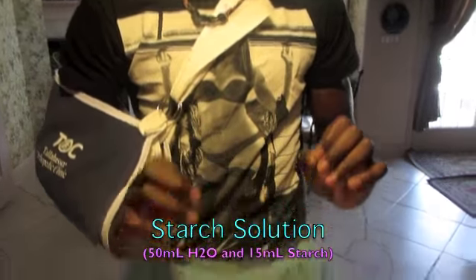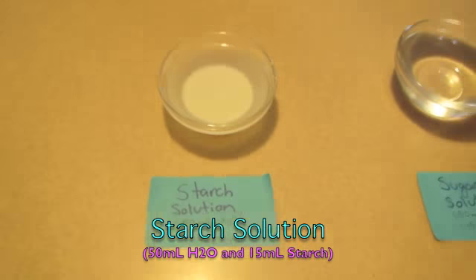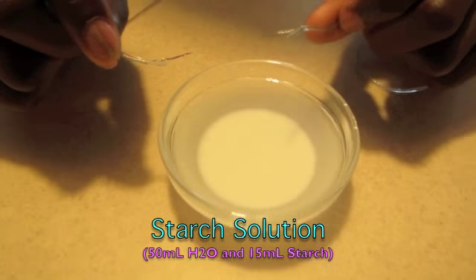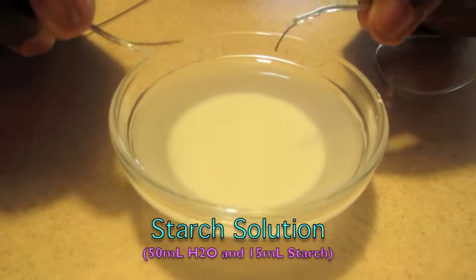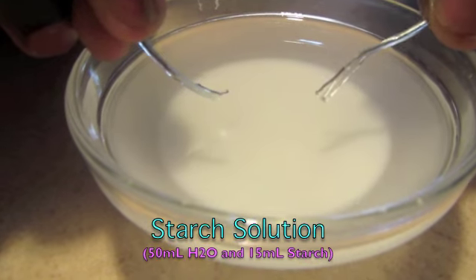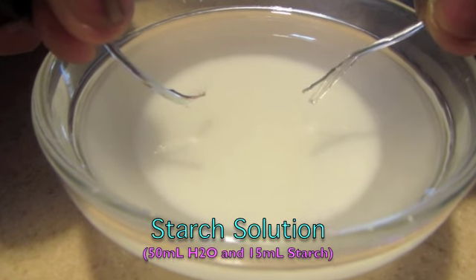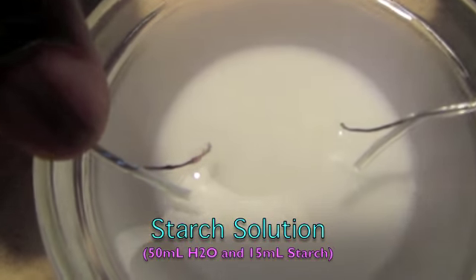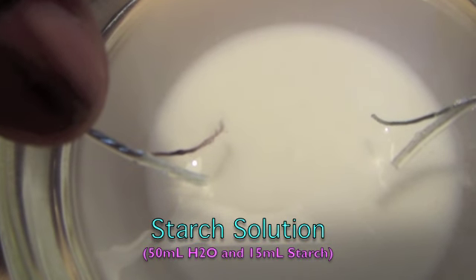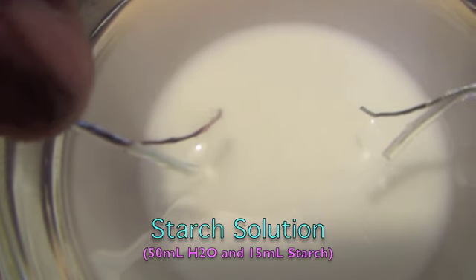I'm about to do the starch solution, and it's covalent as the water and sugar, so it should produce the same amount of bubbles. So let's see the bubbles. Bubbles on the right. See the bubbles forming around the copper.